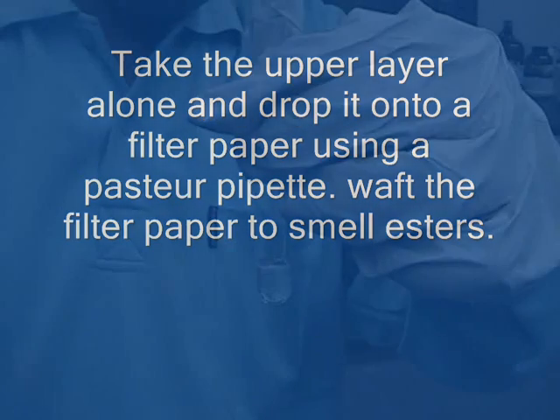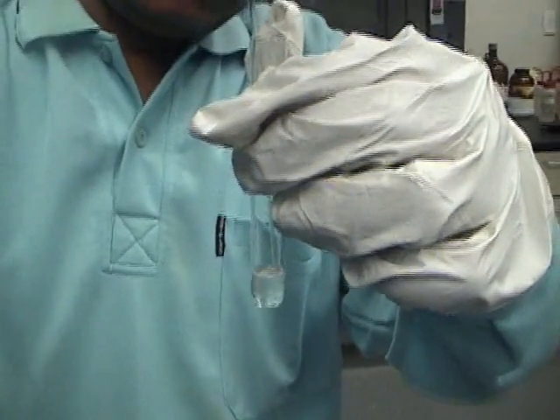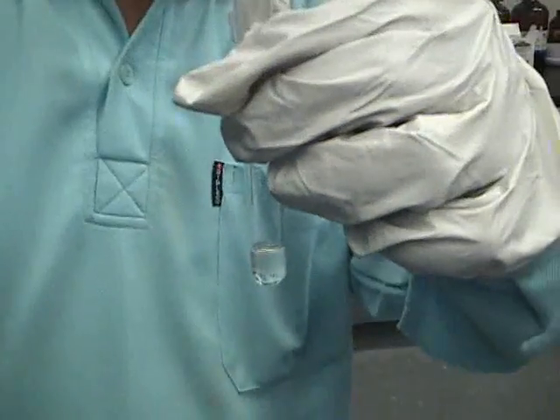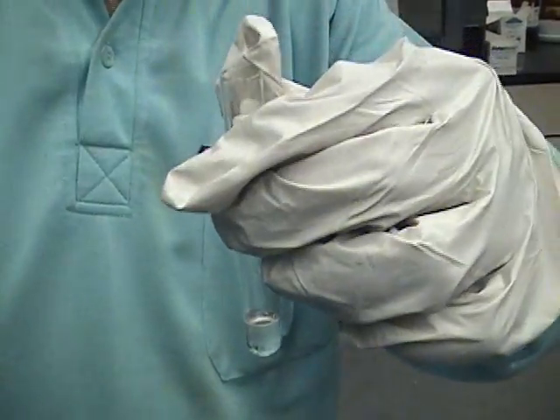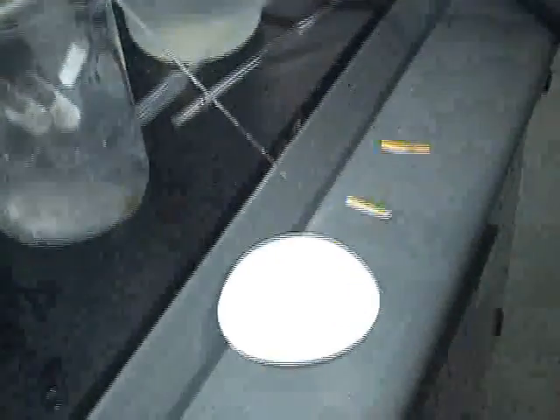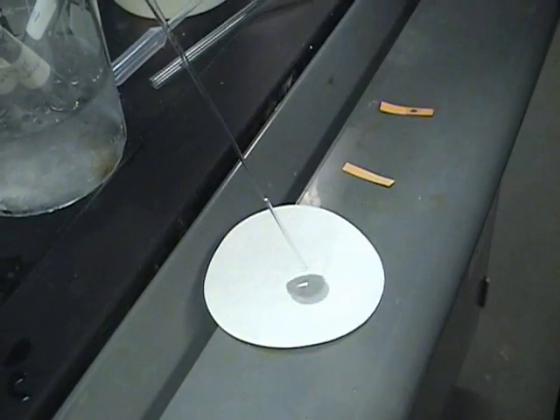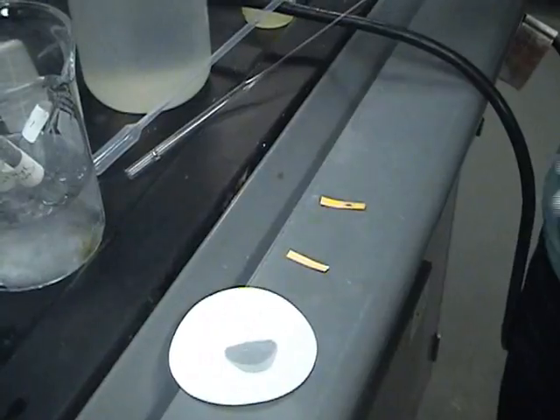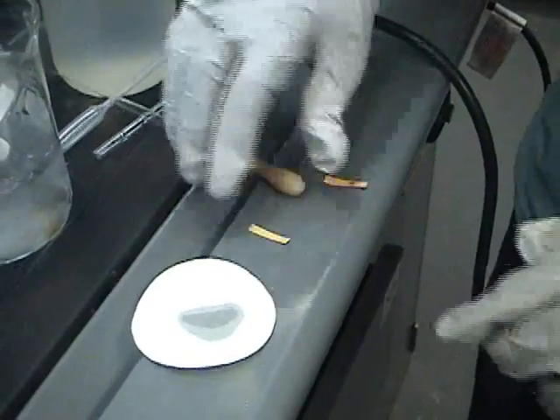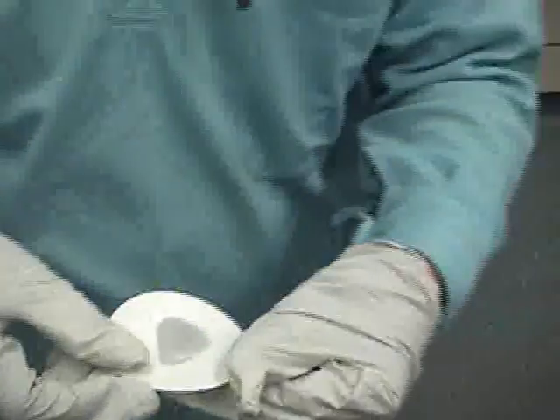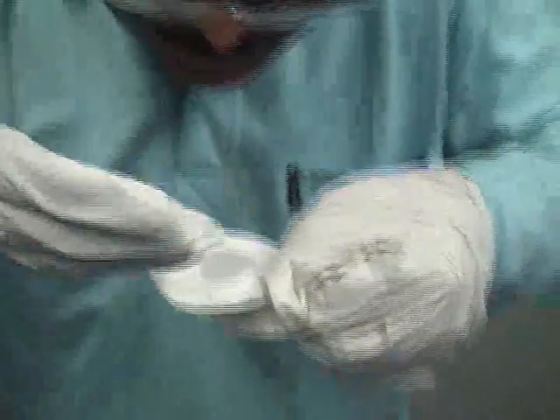To properly smell the solution and avoid getting a nose full of fumes, use a Pasteur pipette to sample the top layer and place a few drops on filter paper. Then use a technique known as wafting to smell the solution without getting a burning sensation in your nose.